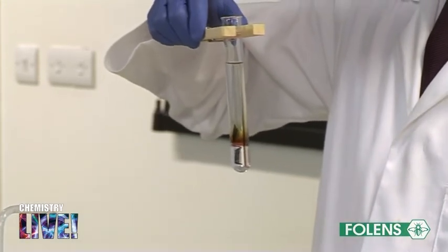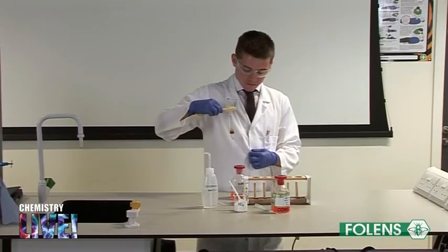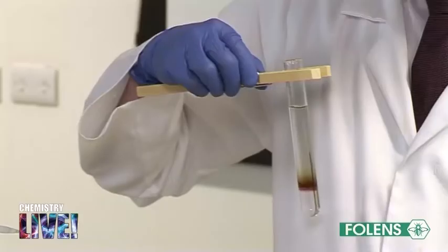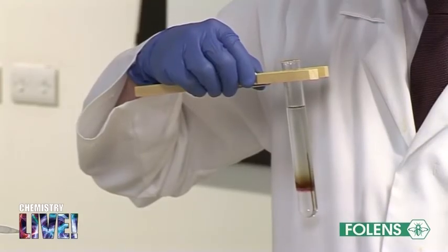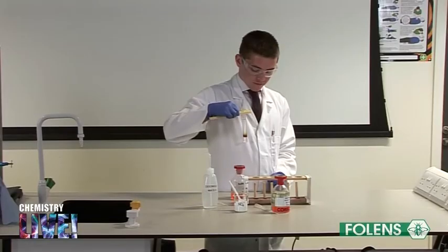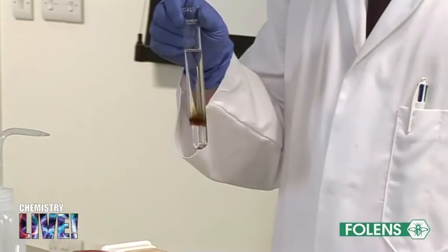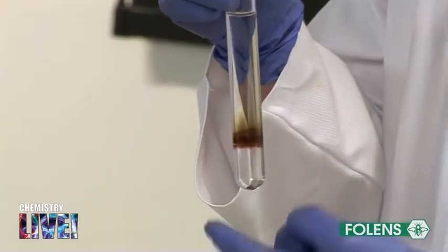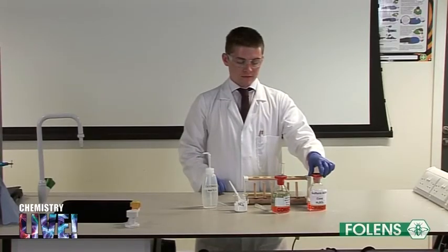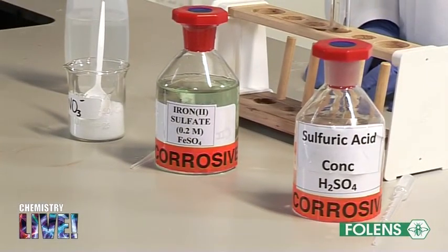This brown ring is formed as a result of the nitrate ion being present, and hence this test is the confirmatory test for the presence of the nitrate ion. As the chemical reactions involved are rather complicated, we need not concern ourselves with the details of these reactions. We conclude that nitrate ions are present in a solution if a brown ring is formed when concentrated sulphuric acid is added to a mixture of the solution and a freshly prepared iron(II) sulfate solution.